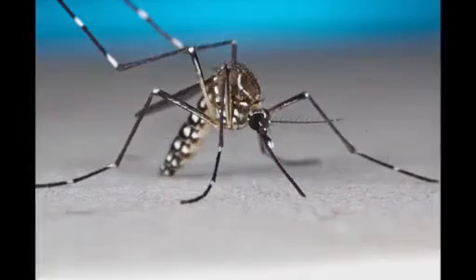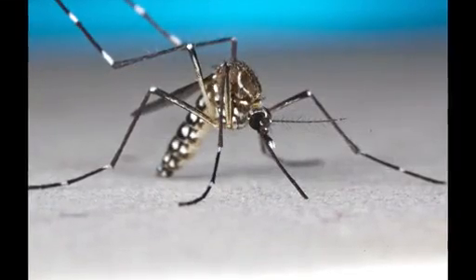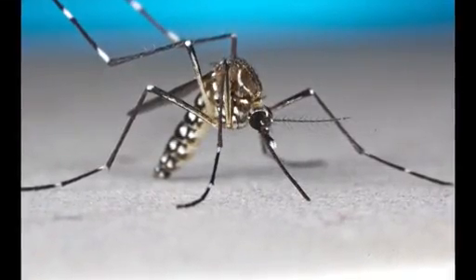We have used this system to study the regulation of yolk protein production and the mechanisms of nutrient uptake in the yellow fever mosquito Aedes aegypti. Aedes aegypti is a principal vector of arboviruses like dengue, chikungunya, and Zika. The mosquito fat body is the sole source of yolk proteins in mosquitoes. This video protocol demonstrates an in vitro mosquito fat body culture system and shows several experimental applications of the system.